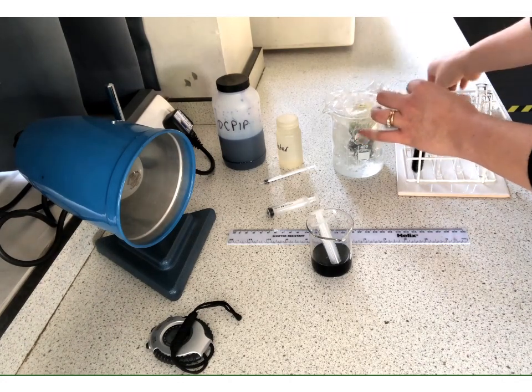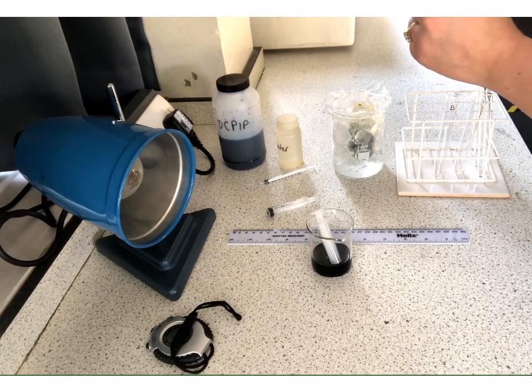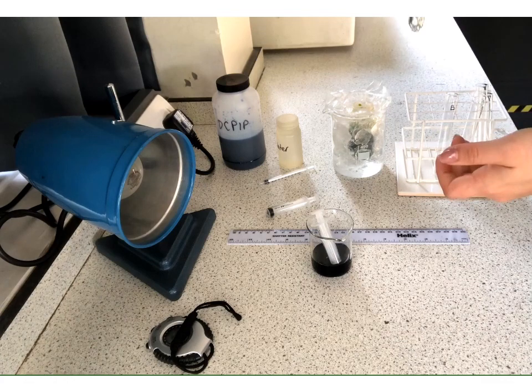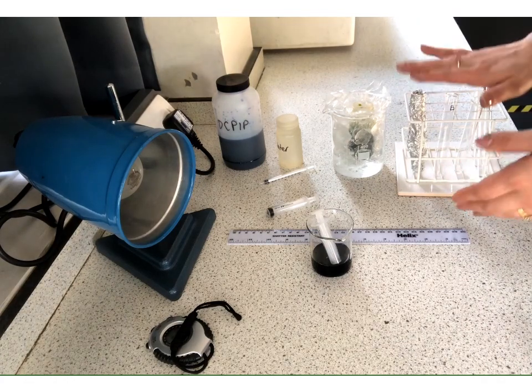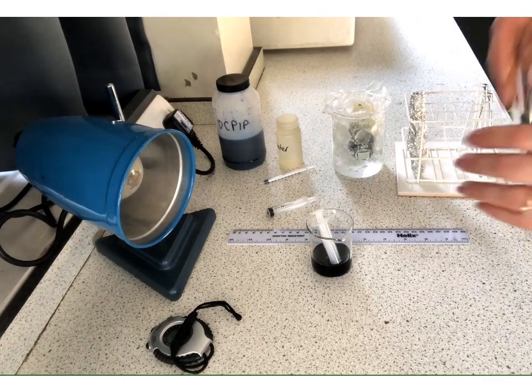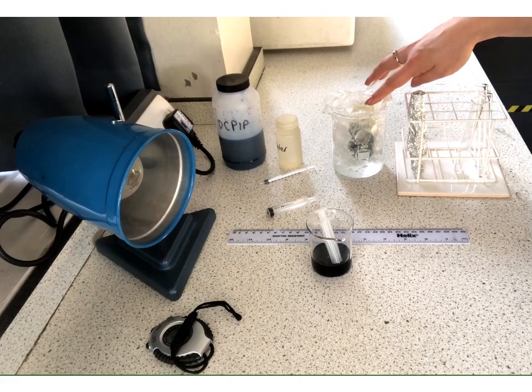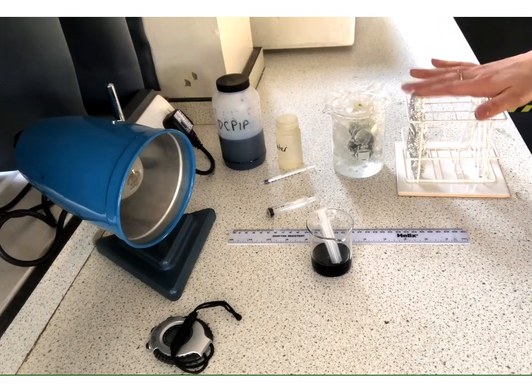And then we need to quickly wrap this up in tin foil. So we are hoping to get absolutely no gaps, really good seal on it, so that we don't have any of the light dependent stage happening. So that is our first control, and we're hoping that when we come back to that we won't see any colour change. Second one, remember, we are keeping the volume the same, so we had 5 of the DCPIP, 1 of the water and 1 of the chloroplast solution in here, so a total of 7 centimetres cubed.